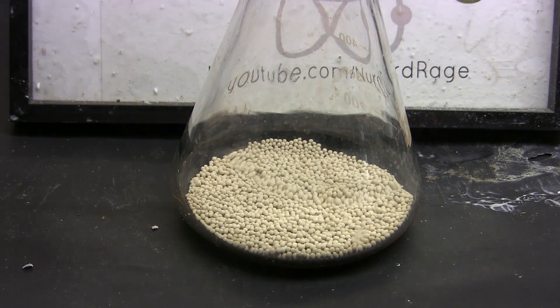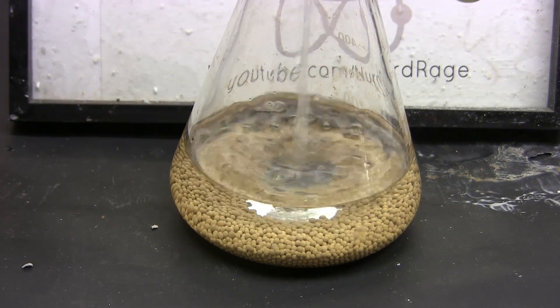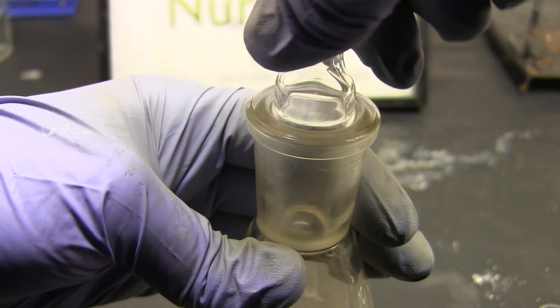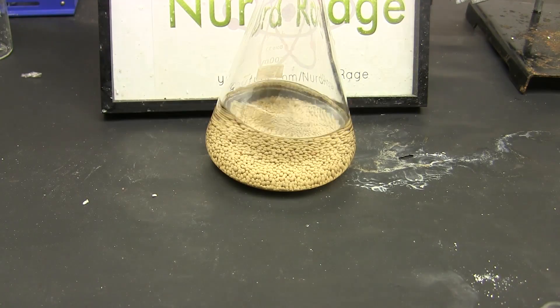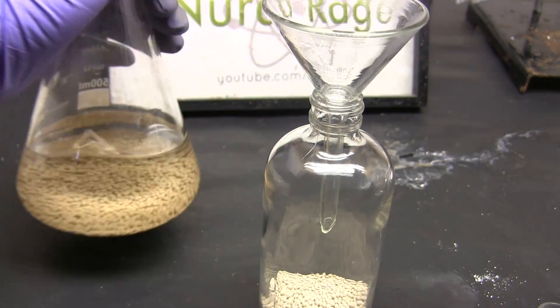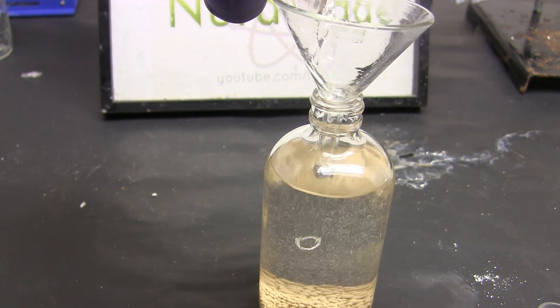The sieves have been heated overnight and cooled back down to room temperature. We now add our alcohol — in this case ethanol — to the sieves, seal the flask, and let it sit for another day. The longer the solvent sits over the sieves the better, as the absorption of water is a rather slow process. Here we are the next day — we pour the dried alcohol into a storage container over freshly dried sieves to ensure that the alcohol remains dry.